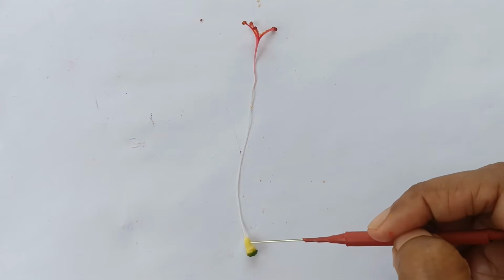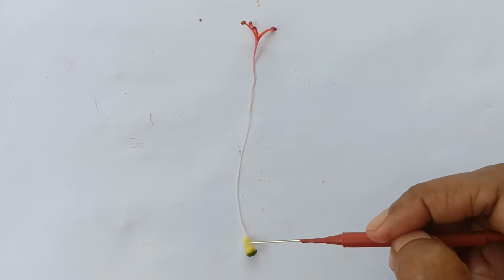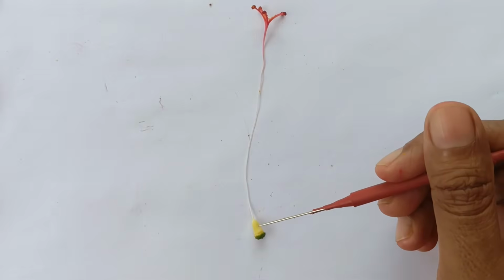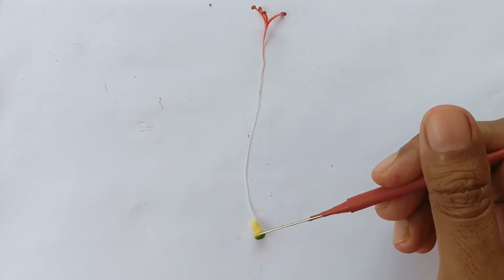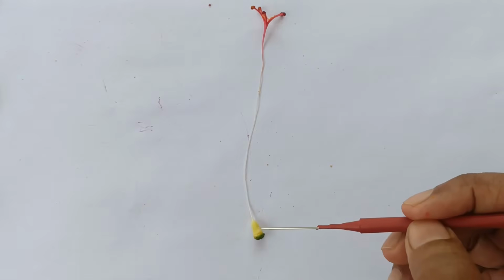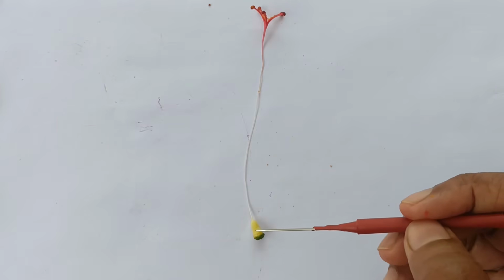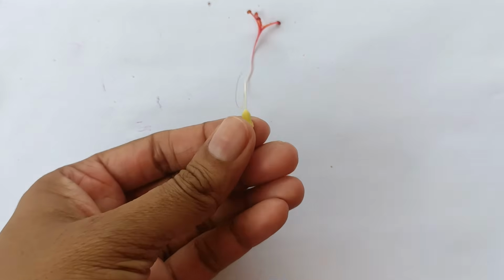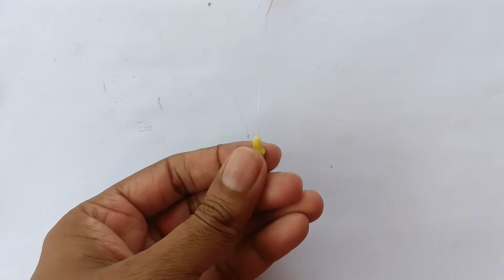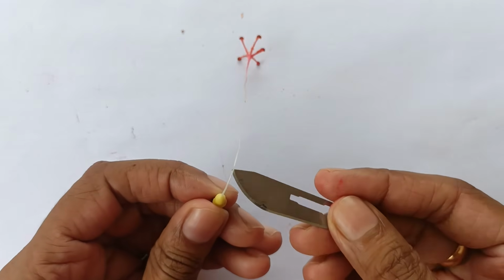Here ovary is pentacarpellary, that is 5 carpels, and all carpels are fused which make ovary syncarpous. You have also observed that ovary is superior as position of calyx, corolla and androecium was below the ovary in the flower. Now we will cut the ovary horizontally and see ovules present inside the ovary. I will make a cross section.